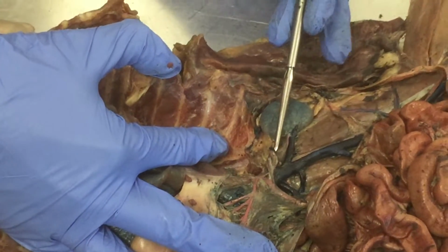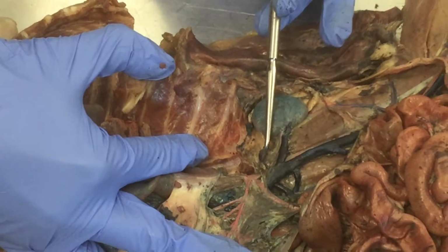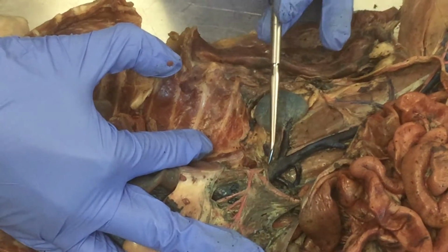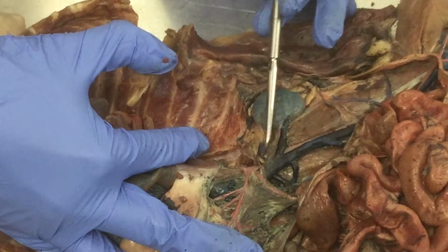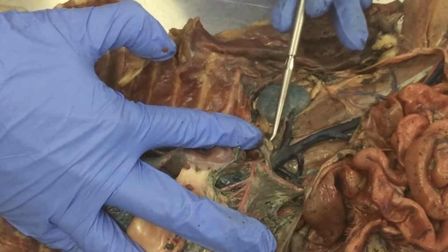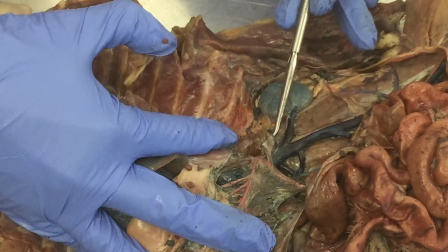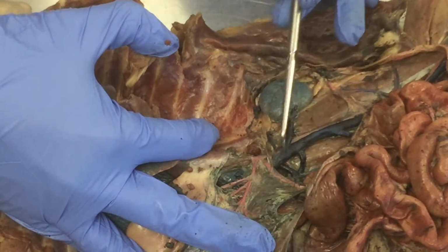Now above the kidney, on my cat, teeny tiny, it's like a little kidney bean. This is the adrenal gland, okay? Adrenolumbar vein usually goes directly over the organ. It's quite large. Adrenolumbar artery may not be as clear. So anything pink that is on the organ, I'm considering that adrenolumbar artery, if you can see it, okay?